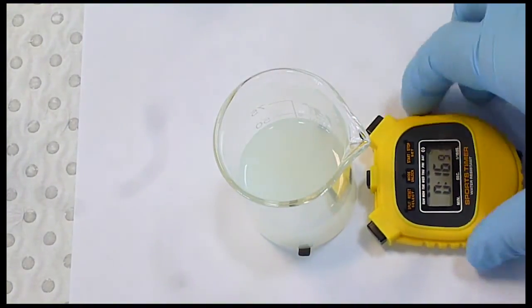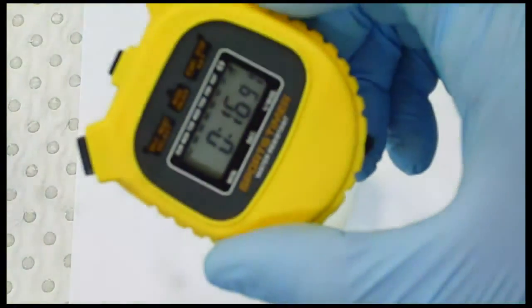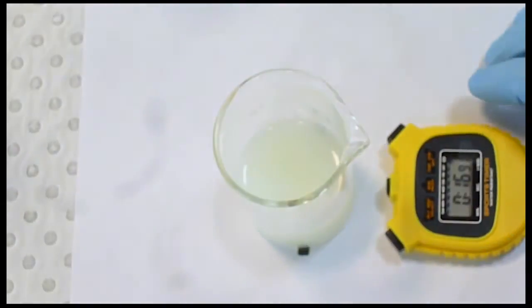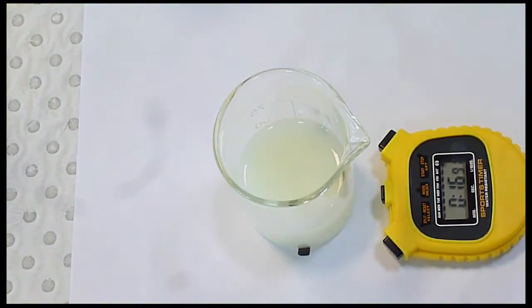Okay, the cross has disappeared and it's saying that it has taken 16.91 seconds, so that would be our reaction rate for this particular reaction.